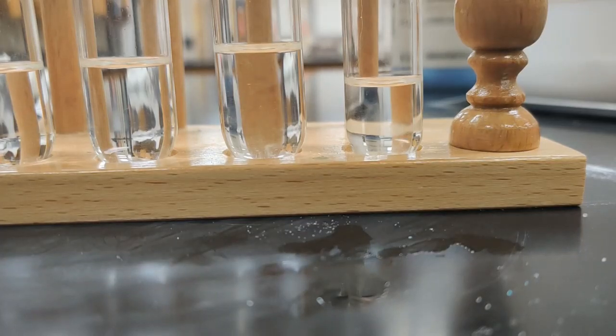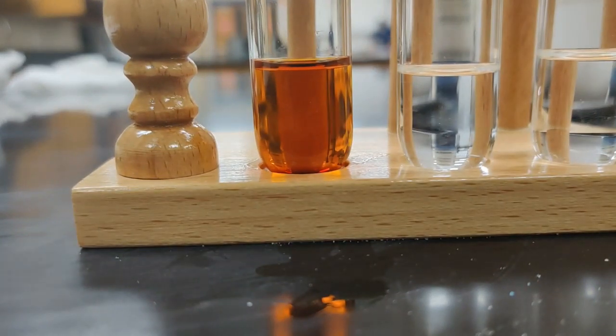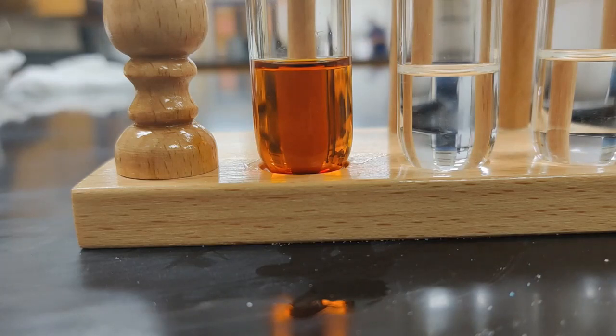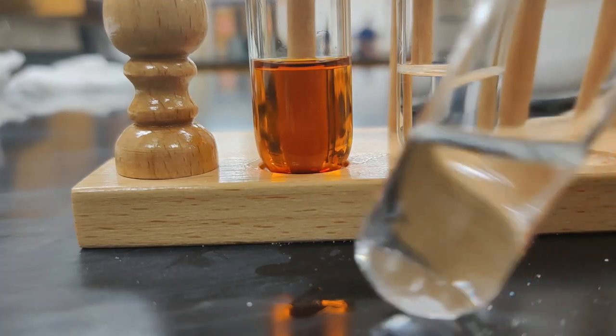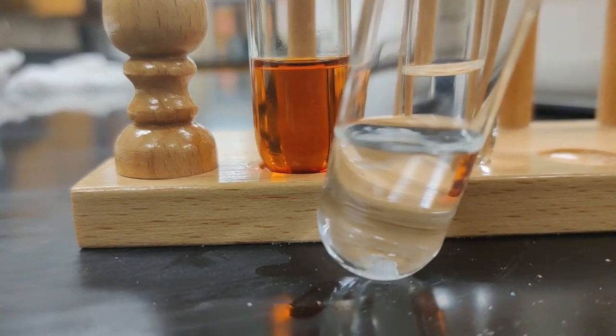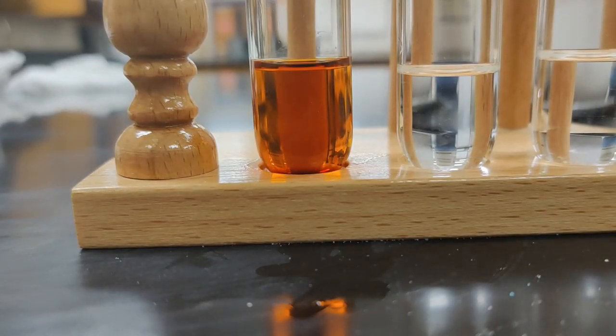So if we have our ethanol results, we can say that, remember, iodine was extremely soluble in ethanol. We can see that dark color that formed. The ammonium chloride was a no. The naphthalene, we said we'd check one more time just to be sure. But yeah, you can still see that solid sitting down there at the bottom, so that's a no. Copper 2 sulfate, we saw that blue sitting still at the bottom. Glucose, not much, if at all. And sodium chloride is a no. So we had one yes and a bunch of no's on ethanol.